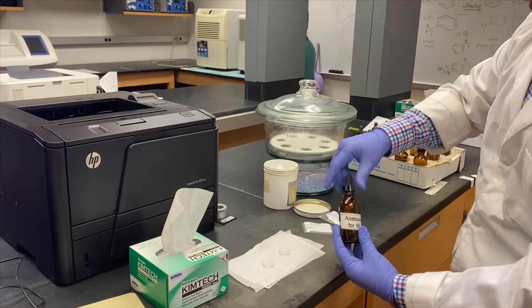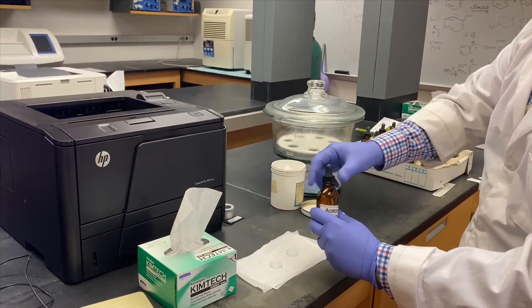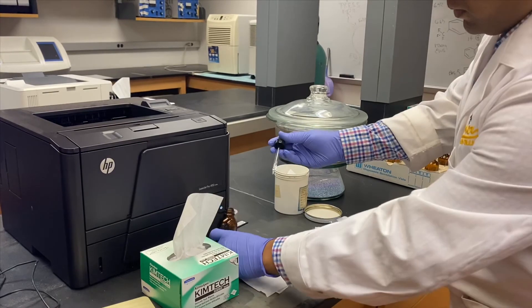Once you obtain your spectra, make sure you clean your salt plates using acetone as shown before.